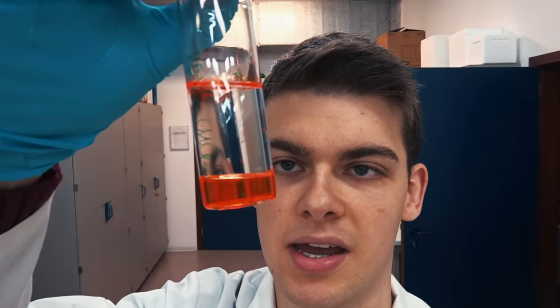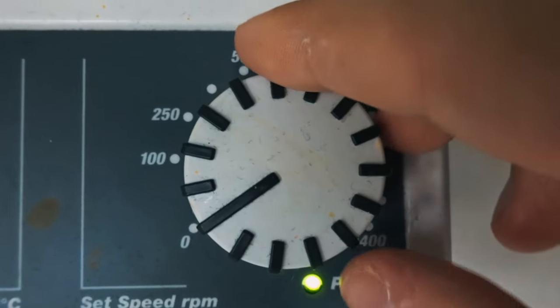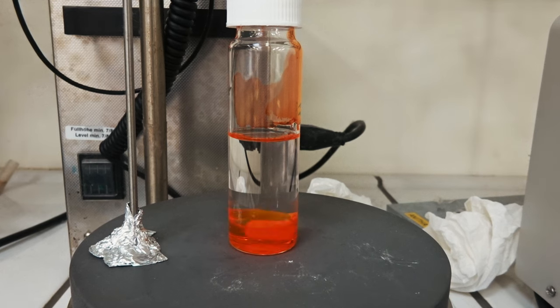This kind of effect happens because the chloroform and the water do not like to mingle with each other, so they stay nicely separated. You can see on top the water phase and on the bottom our polymer dissolved in chloroform. So let's now mix it up.